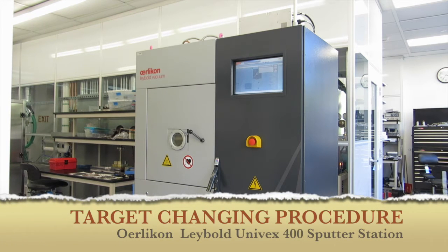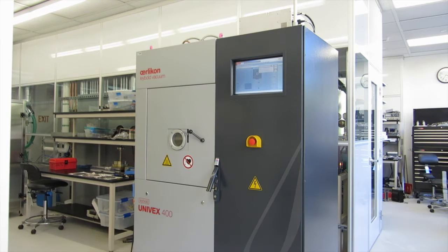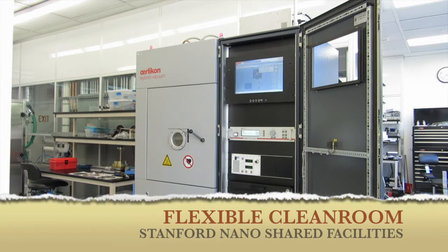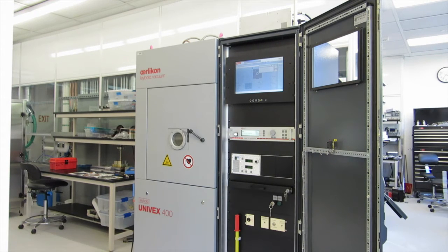This is an instructional video on how to change targets on our new Oerlikon Leybold Univex 400 which uses three 3-inch Angstrom Science magnetron guns.